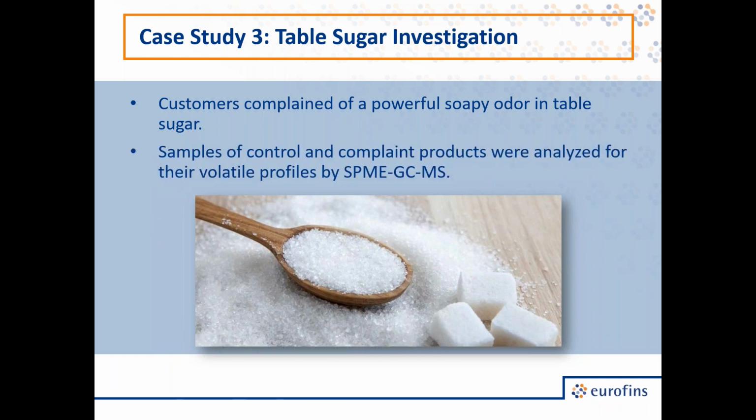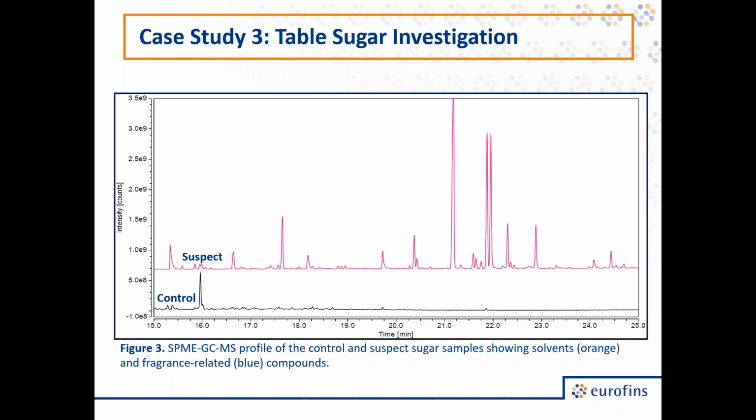And so we analyzed both the control and the complaint product for their volatile profiles by our SPME-GC-MS approach. On this slide, I have the chromatograms of the control sample on the bottom in black, and the complaint sample, or the off-odor sample, in pink on the top. As you might expect, in the control, there weren't very many peaks. That is, there weren't a lot of volatile compounds associated with this product. However, when we looked at the suspect sample, we saw a variety of peaks indicating the presence of components that were not in the control.